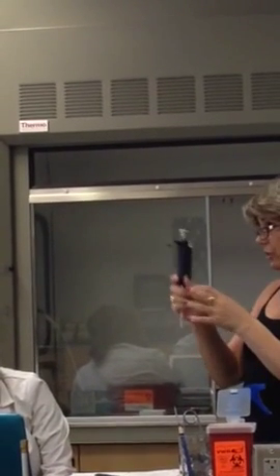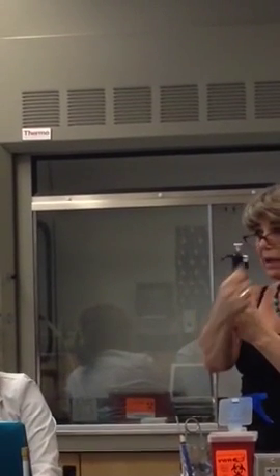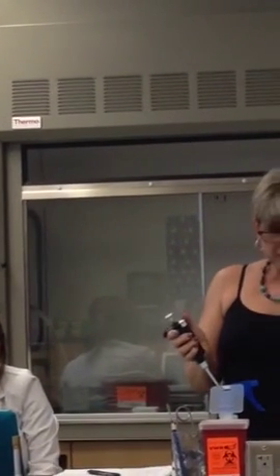Yeah, so set it to 100. The best way to set to 100 is exceed it, go to like 103, and then back it back down to 100. That way you know you're going to get a good volume.